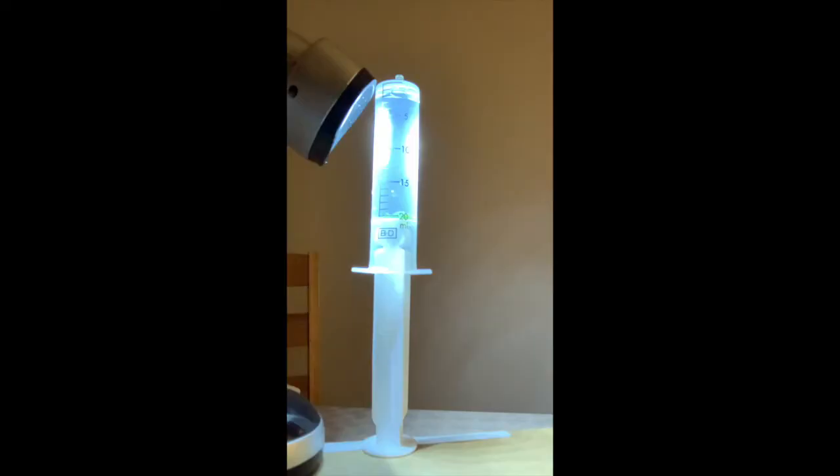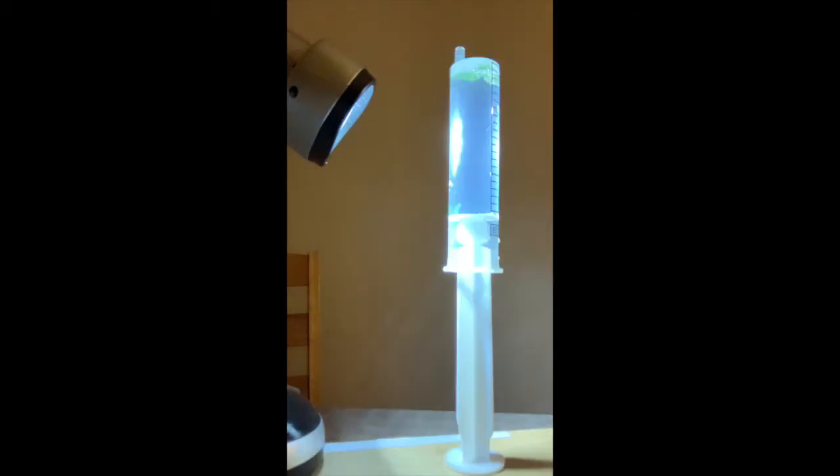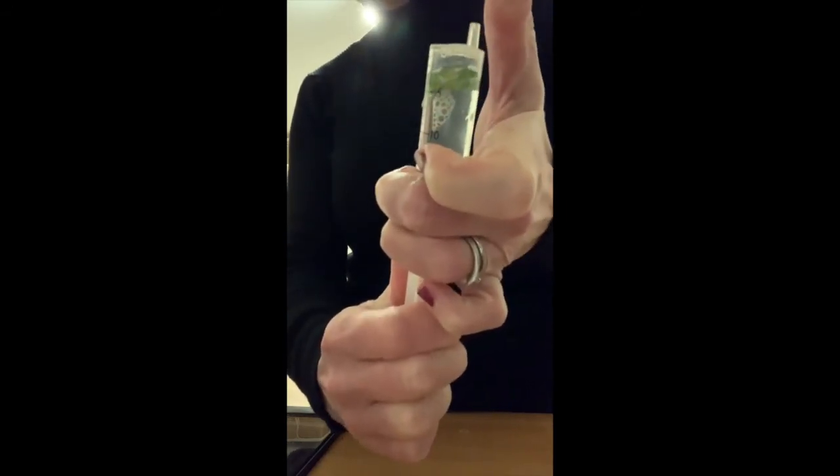So what we need to do is ideally shut the curtains, and then we will measure the distance. It does take some time, so you can put the syringe down at 0 so that it is directly under the light, so the light is shining onto the leaf discs, and then they will start to photosynthesize, produce oxygen, and then they should hopefully end up rising after several minutes. Once all the leaf discs have risen to the top, record the time. Then, before repeating or going on to the next distance, you need to repeat the process of drawing the air out of the leaves so that they sink again.